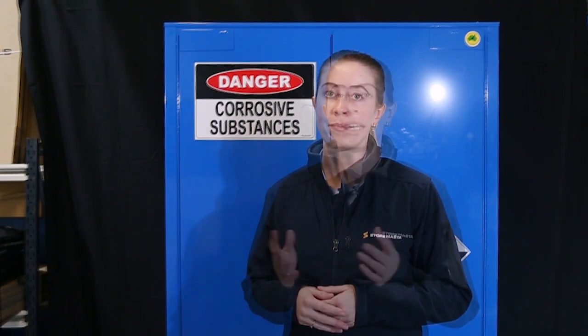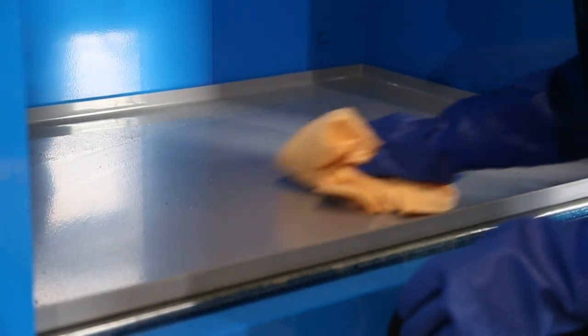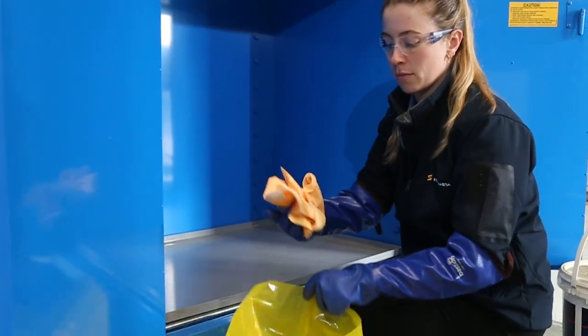After the floor sweep has soaked up the chemical, scrape it out of the sump or spill tray and into an appropriate disposal bag or container. If only a small amount of the chemical has been spilled, scrape out any solids and use a compatible absorbent pad to soak up the liquid. Then wipe away any remaining spillage. Discard the used pads into a disposal bag or container.